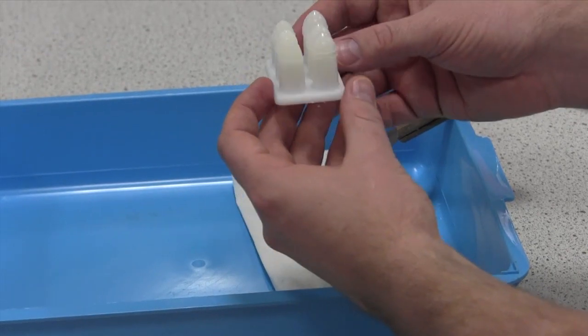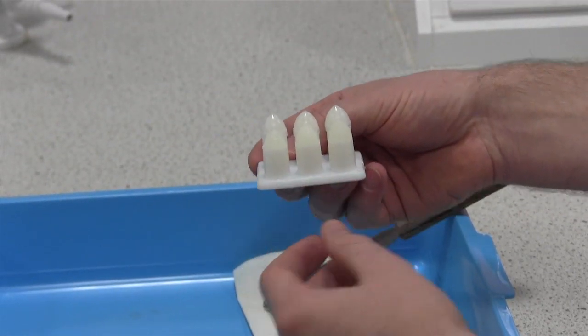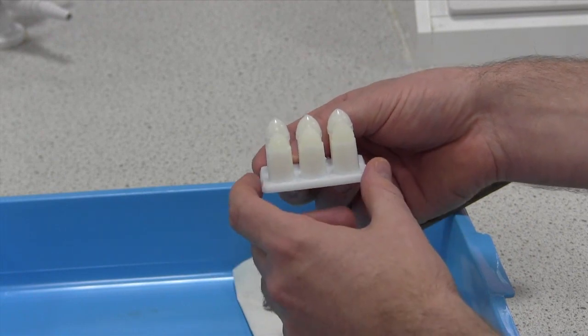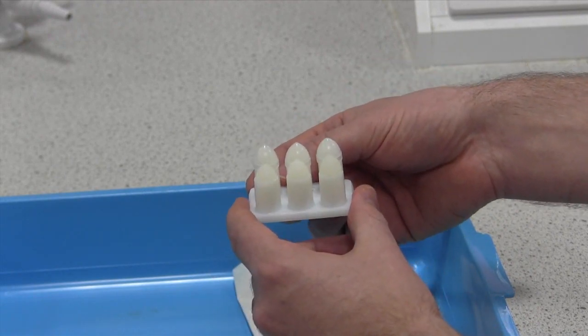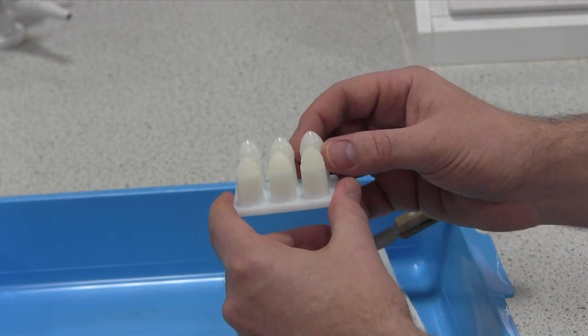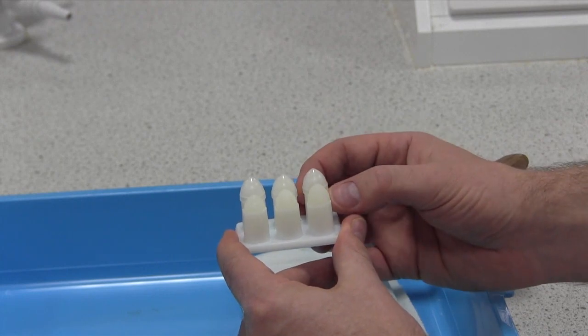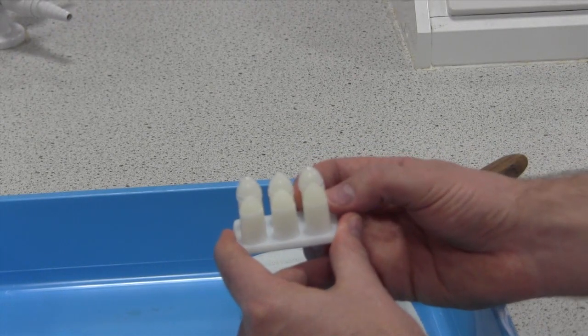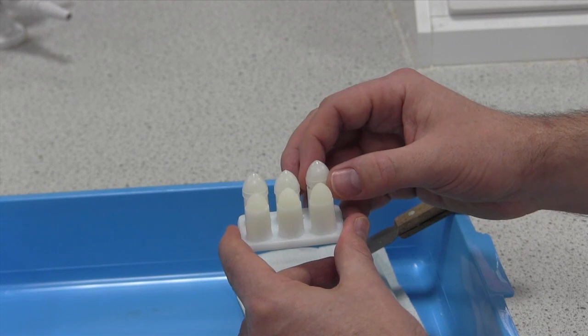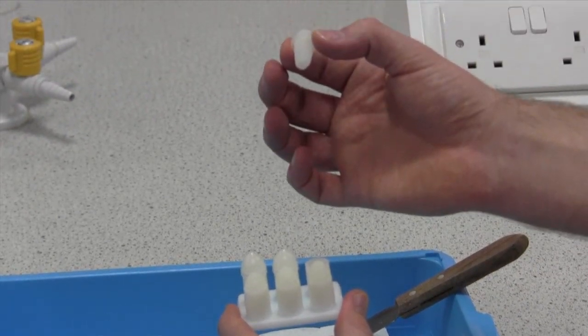Here's one that's a bit more obvious in terms of caps on and caps off. You can see they're not all completely the same, but they're pretty close. The caps are simply slid on to these bases, so it is just a matter of pressure and sliding them off. These are the ones we've already pre-released, and you can see it's almost a little bullet shape within the cap.